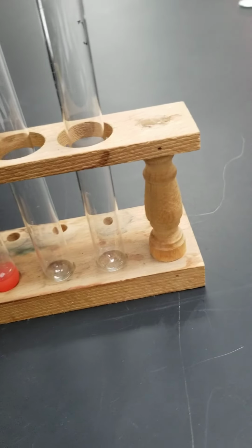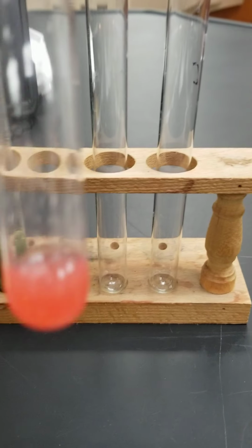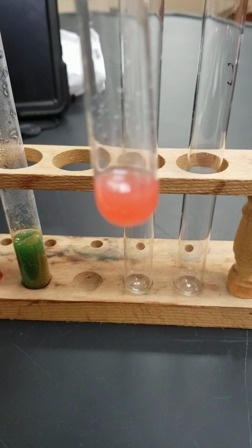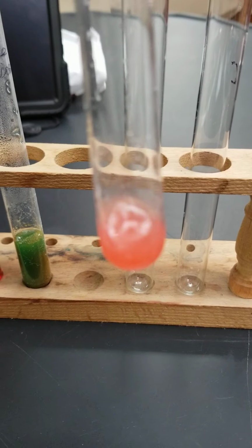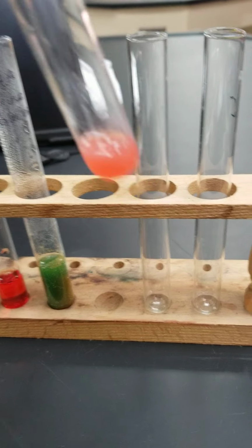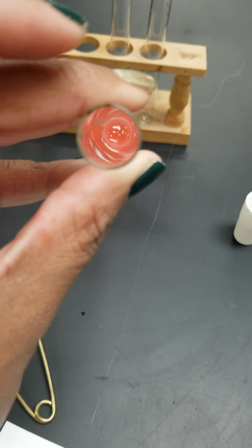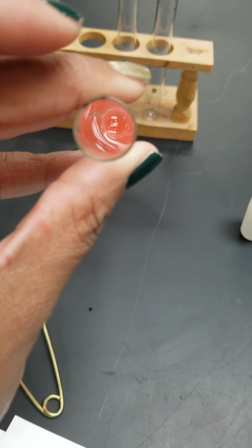Let's go back and look at the chloride test. That is not the test tube. There we go. So this is the one that started off as just clear red. It's gone this milky, almost orangey type color. There is a white precipitate. I was able to show you just a little bit. If you look down, you can see that there's some white things floating. That is the white precipitate. That is the result of our silver nitrate combining with our blood.